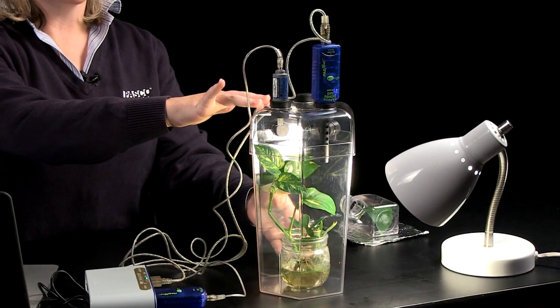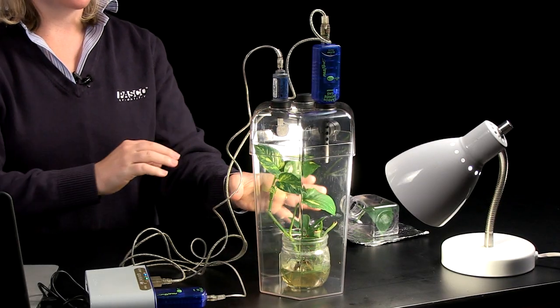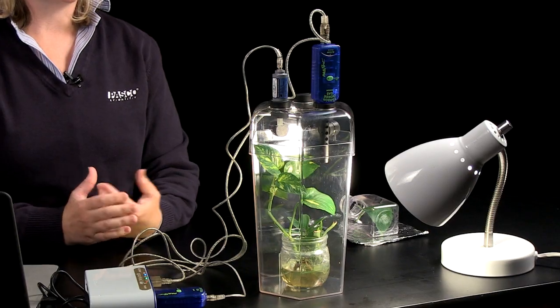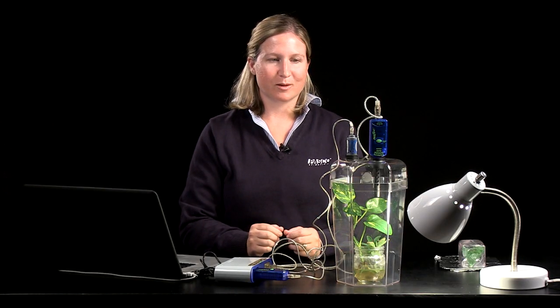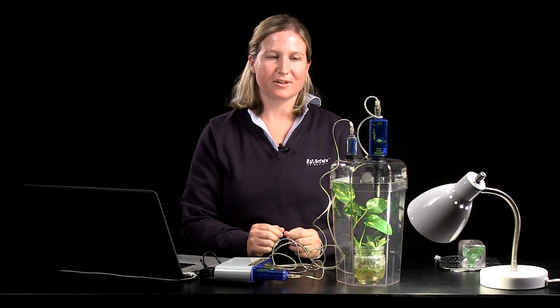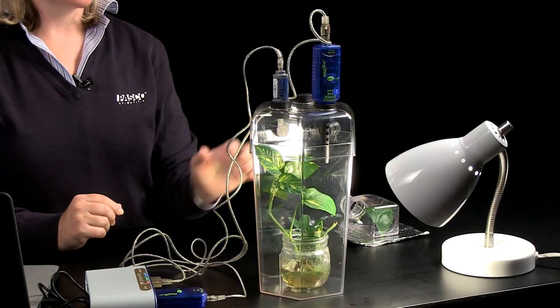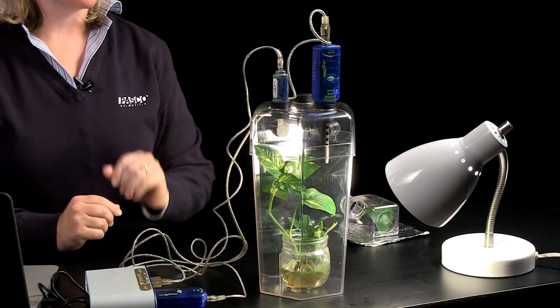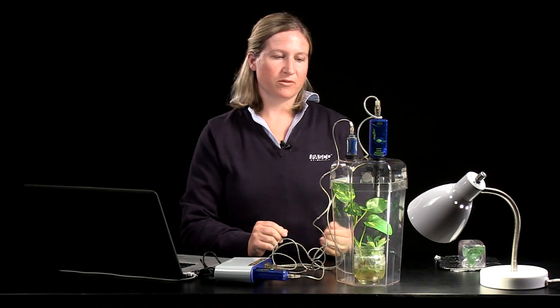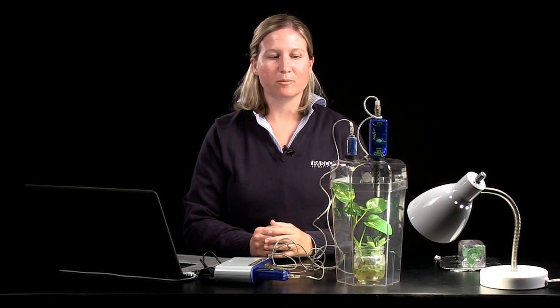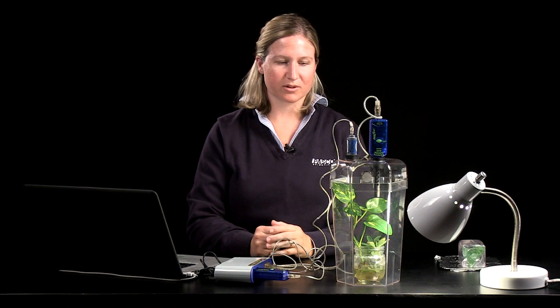You can also use the carbon dioxide and oxygen gas sensors to investigate photosynthesis with your students. In this setup I have our large eco chamber with a small plant and you can really put any potted plant that fits into the chamber in a setup similar to what you see here. So I have the carbon dioxide gas sensor and the oxygen gas sensor in the setup and all of the other openings of the eco chamber I've sealed with rubber stoppers. You want to provide the plant with a nice direct light. I'm using a bright compact fluorescent light bulb as the light source.